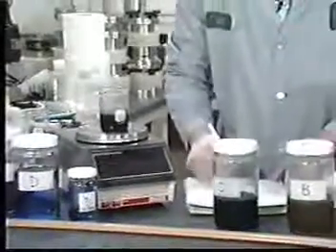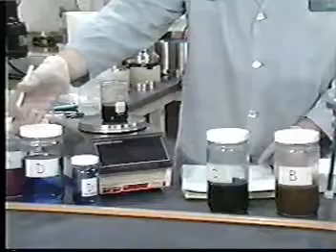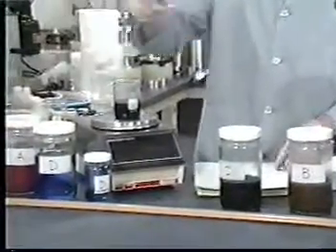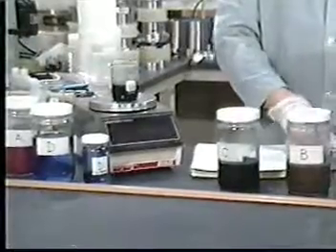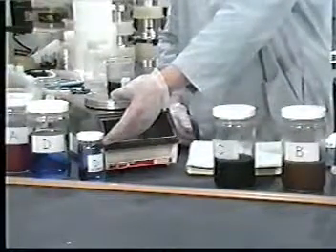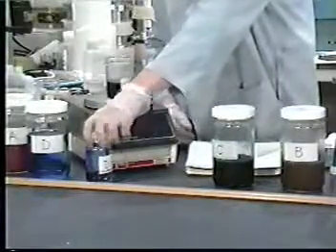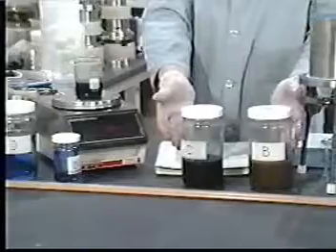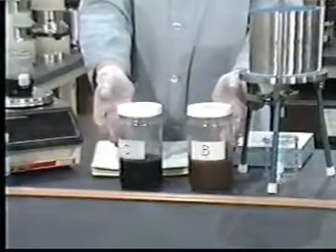Remember that wastes like D, which contain less than 0.5% solids, do not require extraction of those solids. That waste, after filtration, is defined as the TCLP extract. Be sure that the amount of waste is enough to support all the analysis. For wastes such as B and C, use the percent solids information to determine the optimum sample size.